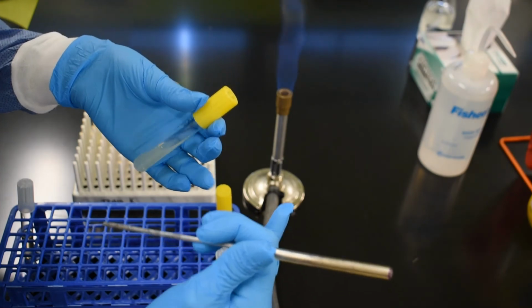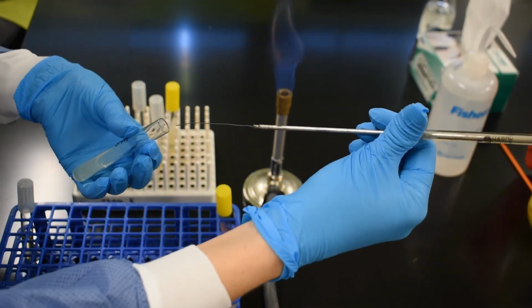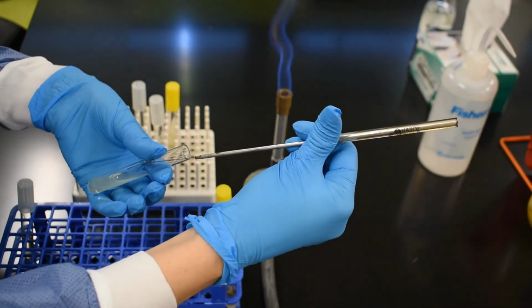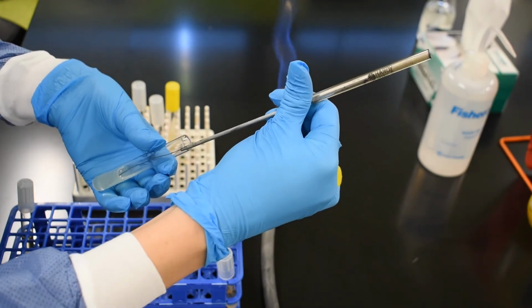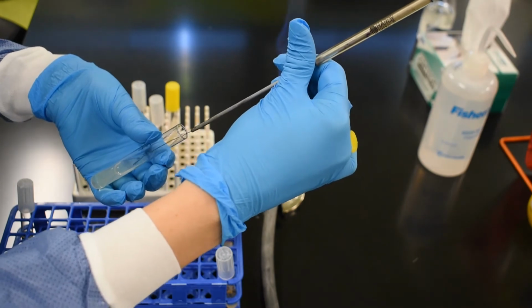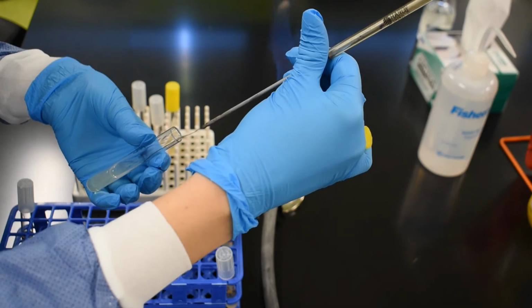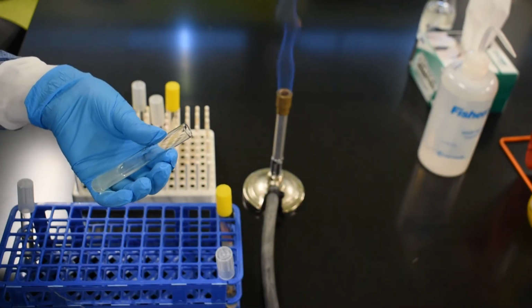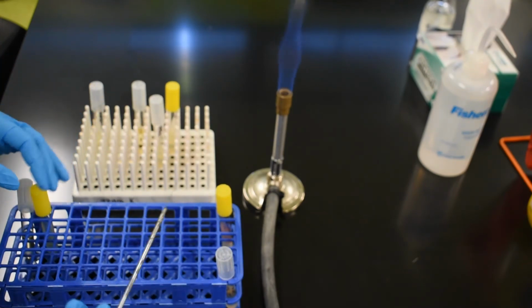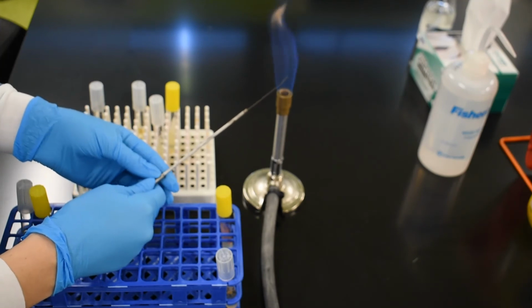and now I pick up my fresh agar slant, remove the lid, and now what I want to do is take the needle and put it all the way to the bottom of the slant, and then very gently, once again, without piercing the surface of the agar, I want to skate the needle across the surface of the slant in a zigzag fashion all the way up to the top. Once again, we need to re-flame the needle in order to sterilize it.